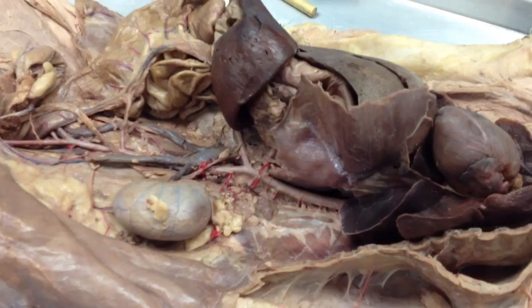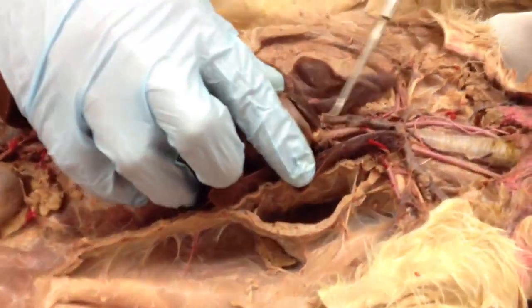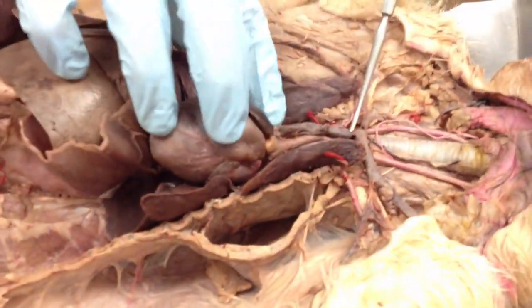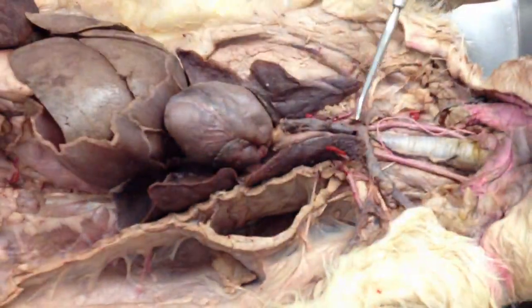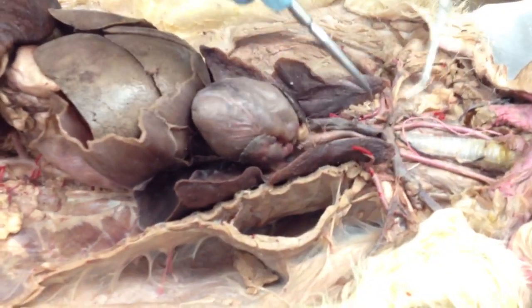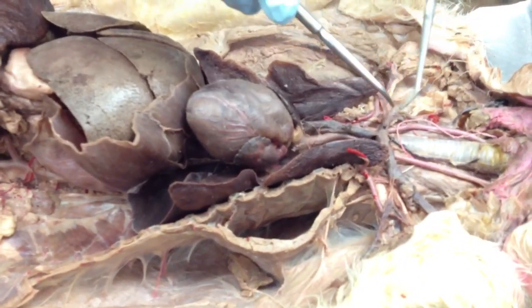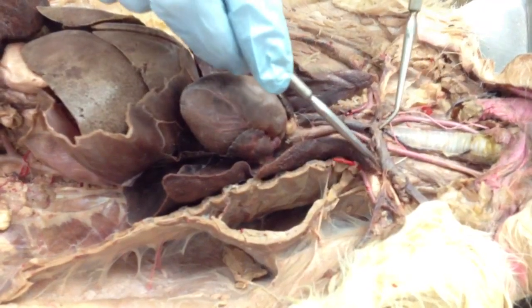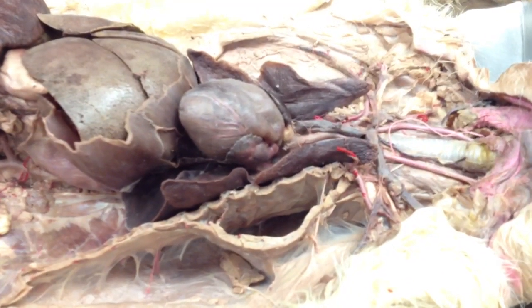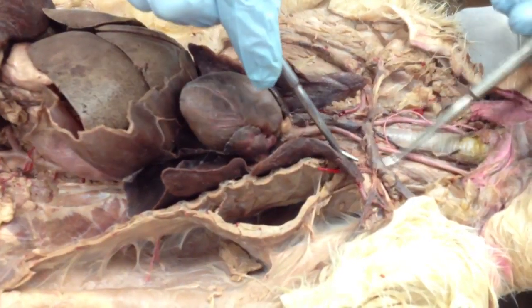The veins. So this guy here, coming directly out of the heart, superior to it, is your superior vena cava. So I'm talking about between those 2 probes right there. It's kind of screwed up, but it branches right there. See how it goes in that direction and branches that way and that way? So that's your brachiocephalic vein. Obviously there's left and right, but on the worksheet it just says brachiocephalic vein, so I will accept that as an answer.